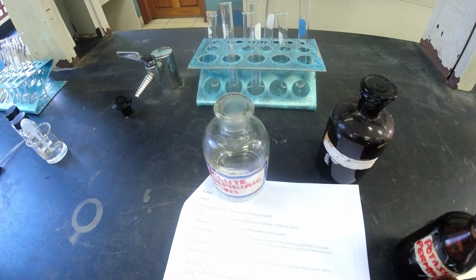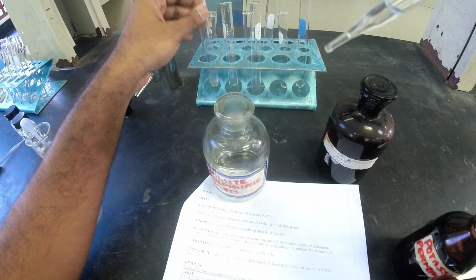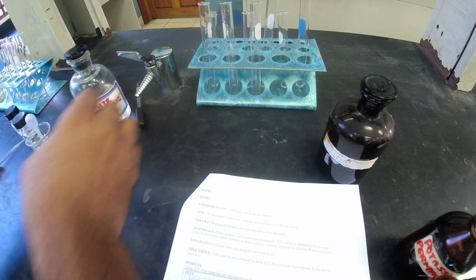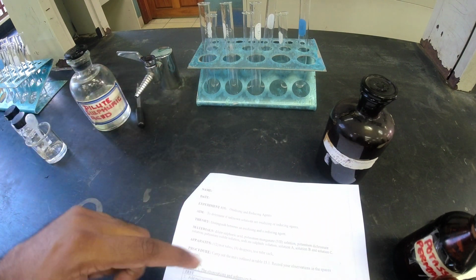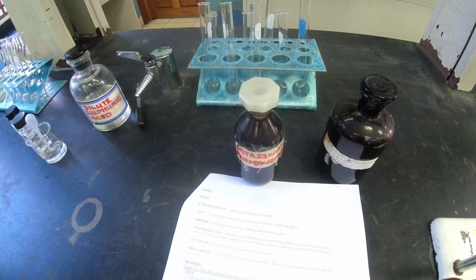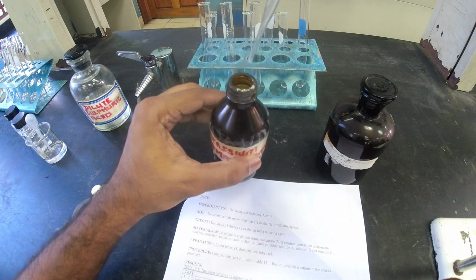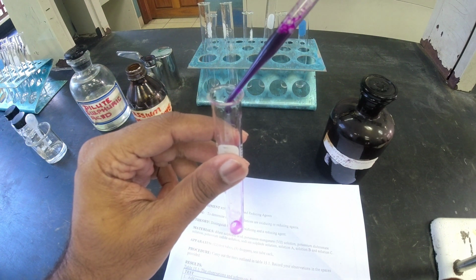Alright. Just a little bit. 3 drops with the dropper, for 3 test tubes, and then put that aside, and then we add in 2 drops of sulfuric acid followed by 3 drops of potassium permanganate. So let me get the potassium permanganate. There's the potassium permanganate here. So not that. Boom. And we want 3 drops of this. See how nice the color is in my test tube. 1, 2, 3.